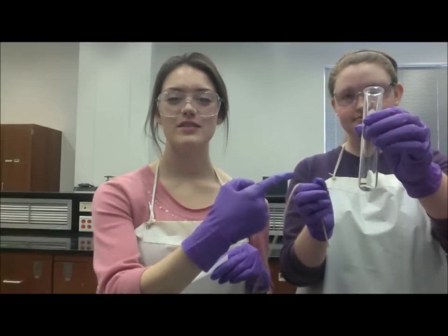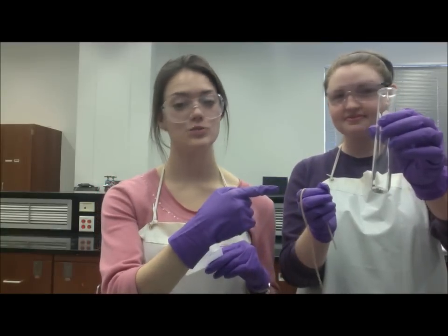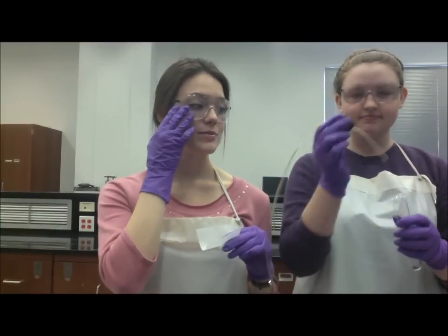You should have about this much. If you have way more or way less, you probably did it wrong. So then put on the rubber stopper, which you will need later on in the experiment, and after this you're ready to set up the rest.